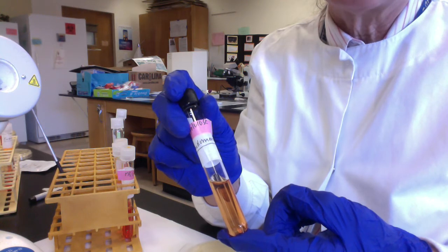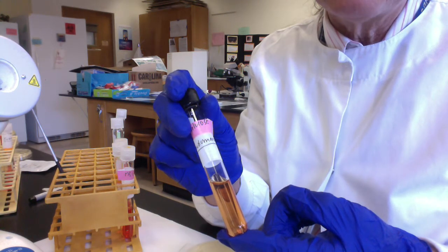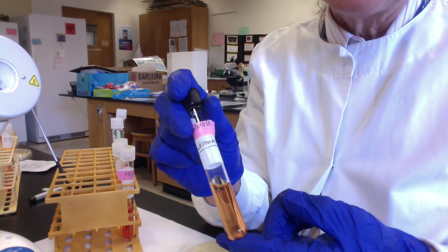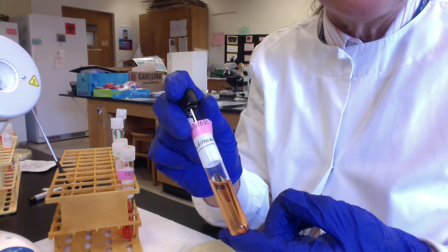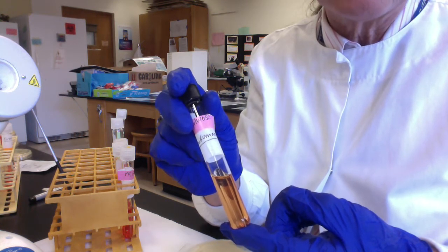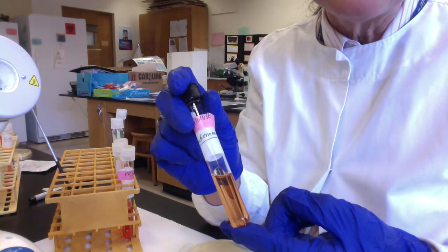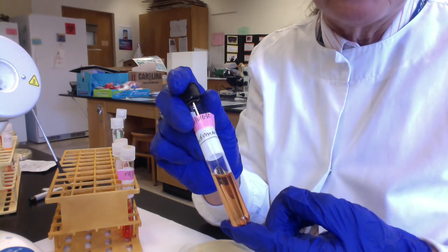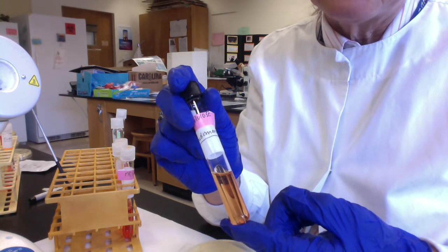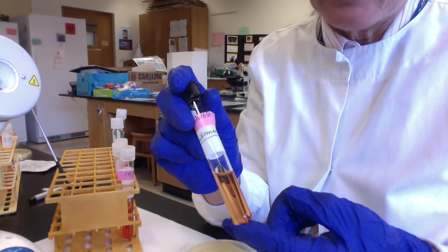So if the medium is yellow after incubation, that means your microbe could ferment the sugar. If the medium is red or fuchsia, that means your microbe couldn't ferment the sugar. Instead, it tore apart the amino acids, releasing the amino group as ammonia, which we know is a weak base. The pH increases, and the phenol red turns that deep red or fuchsia color.